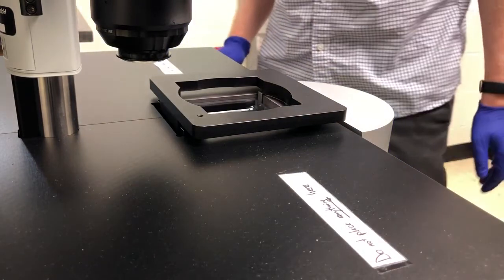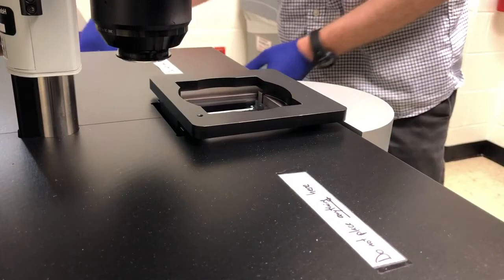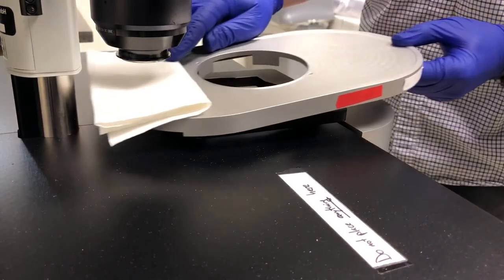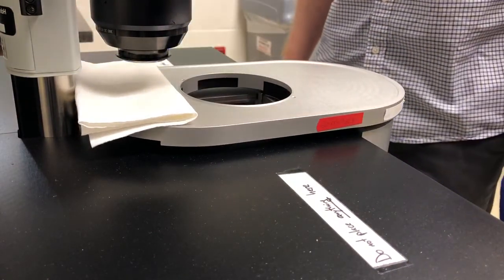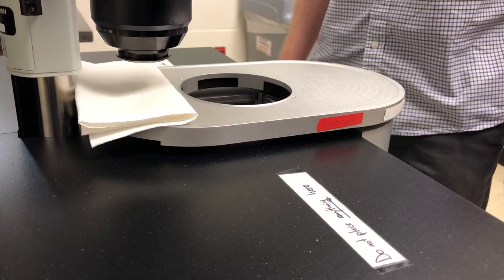The rest was clean, so we don't need to do anything. Luckily, put this back on, and now I'll show you how to set up the alignment tool.